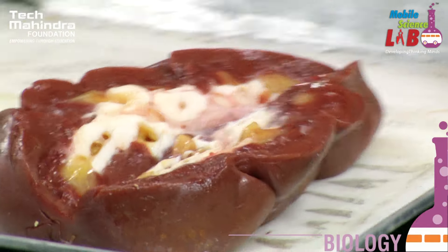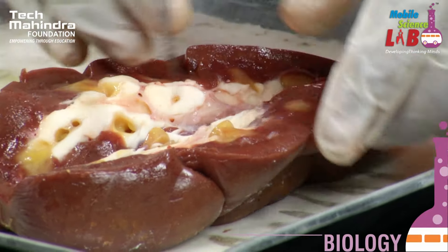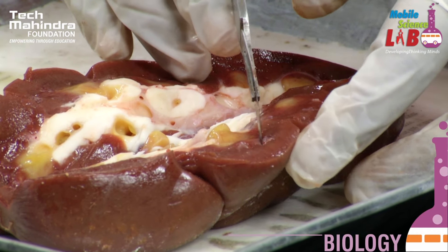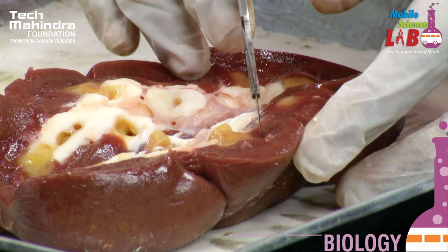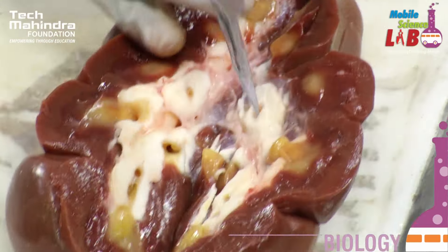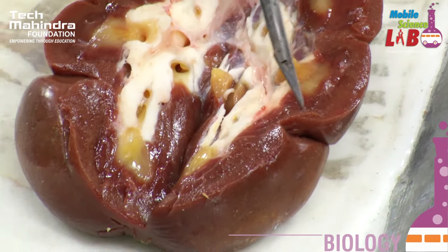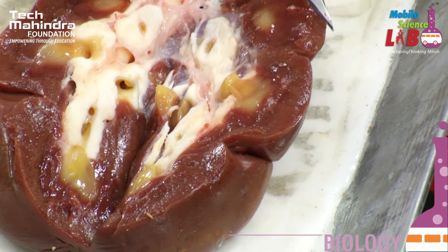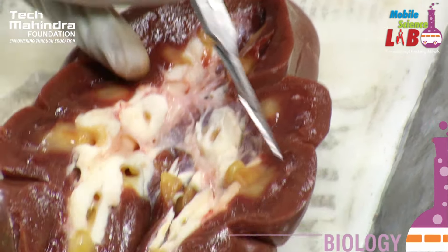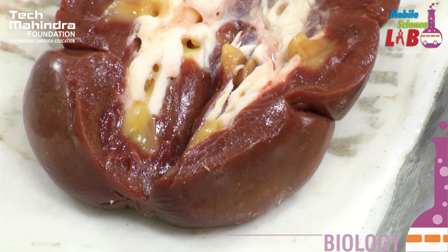Here you can see the area. The area from here to here, which is a light brown colour, is known as a cortex. And the area here — you can see a pyramid-like structure here. The structures in between these structures — this area is known as medulla.